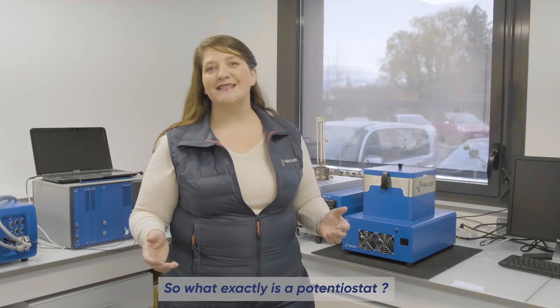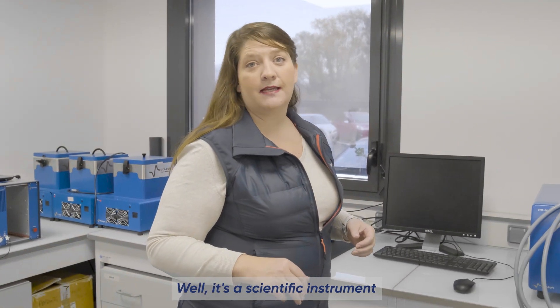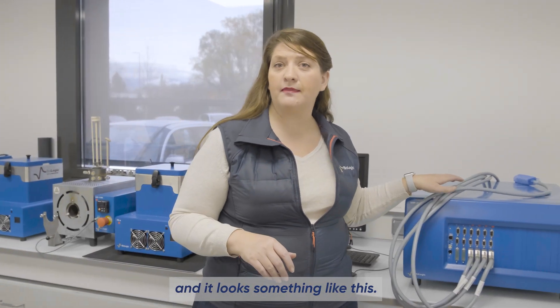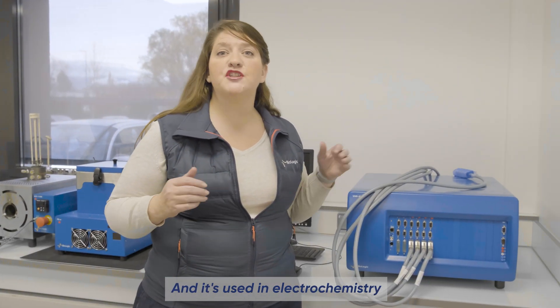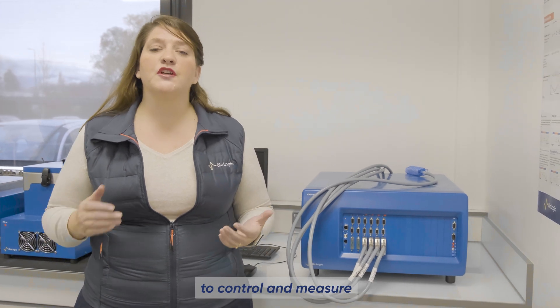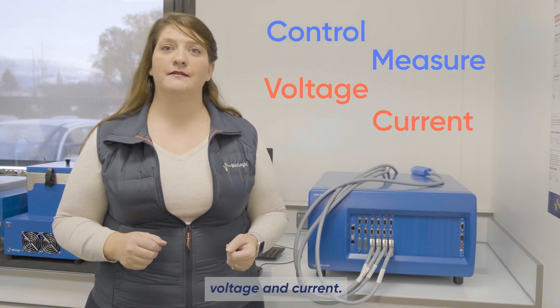So what exactly is a potentiostat? Well it's a scientific instrument and it looks something like this, and it's used in electrochemistry to control and measure voltage and current.